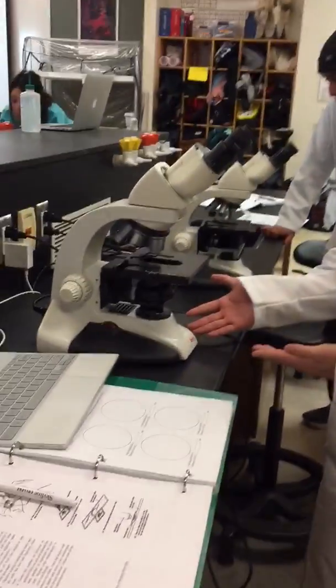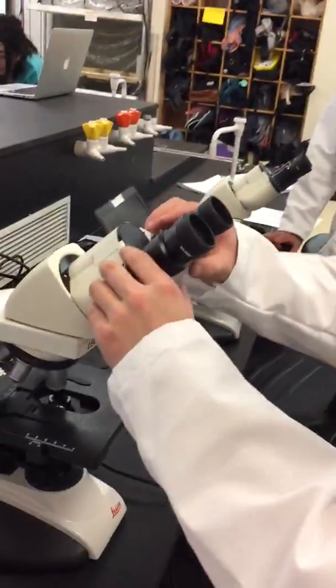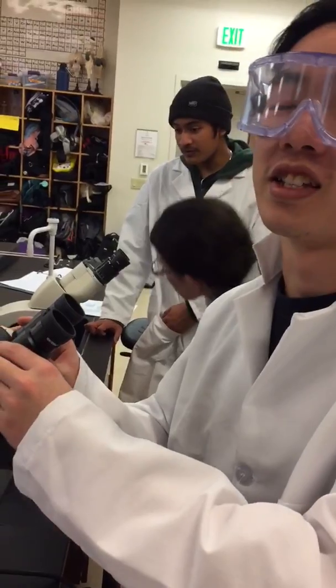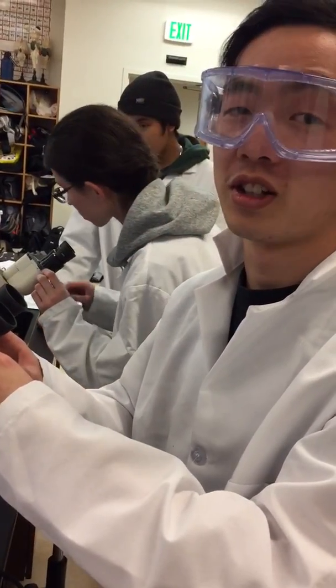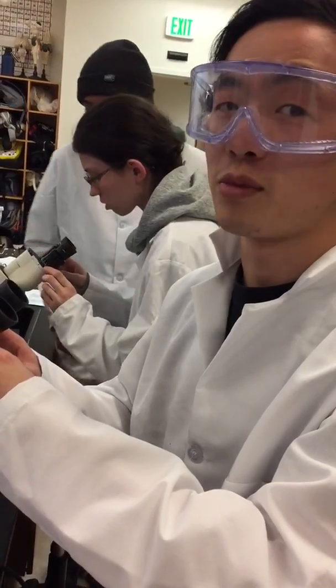Hello, my name is Ricky and today we are going to look at this microscope. So these two here are the eyepieces and this is where you place your eyes and you look through it to look at your sample and specimen.